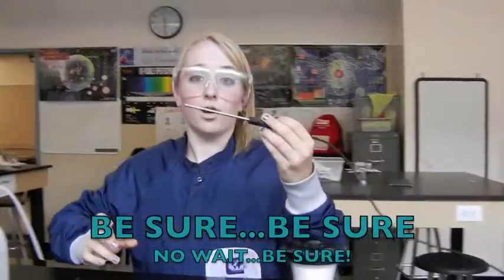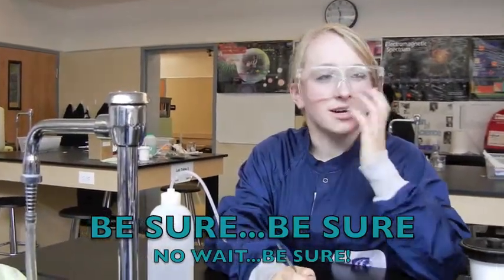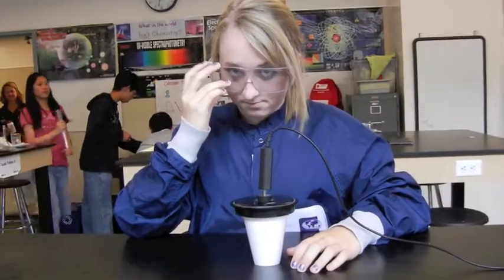In between experiments, make sure you wash your temperature probe.